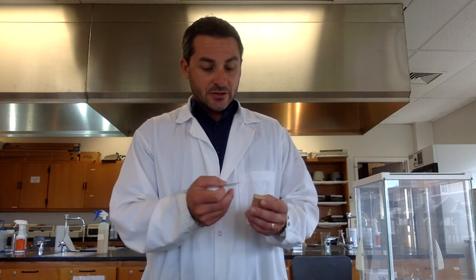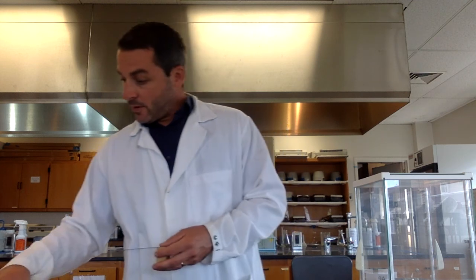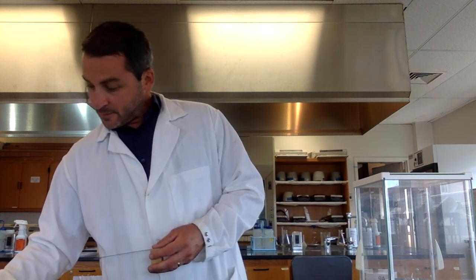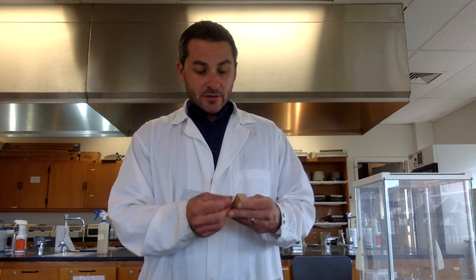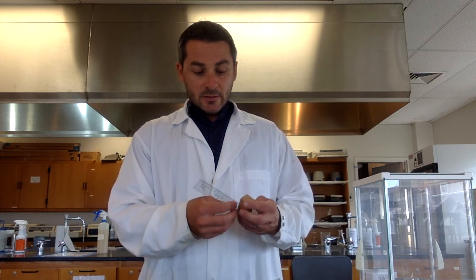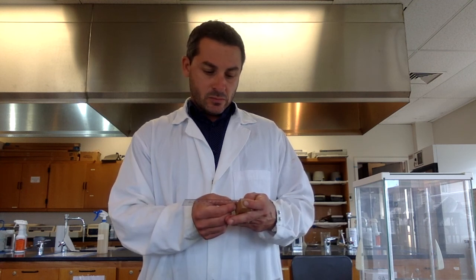Then I'm going to measure the length, 2.4 centimeters. Record all that on the data sheet. And then I'm going to measure, again, the height, which is 2.3 centimeters. So if I multiply all of those together, I will get the volume. So the calculations will be explained on a different show here. All right, so that is that.